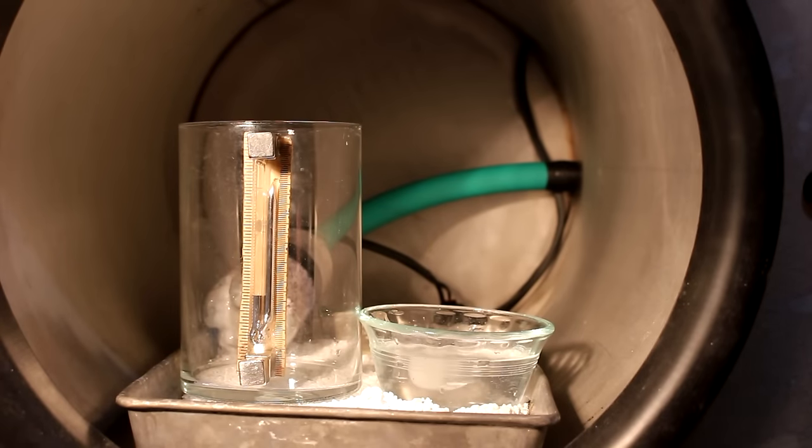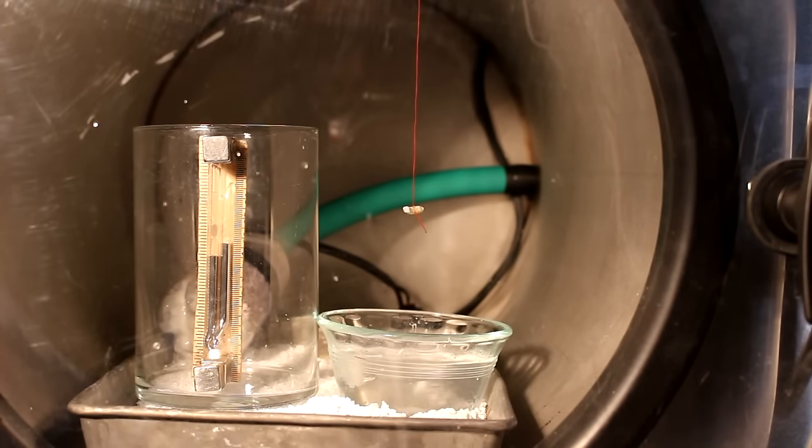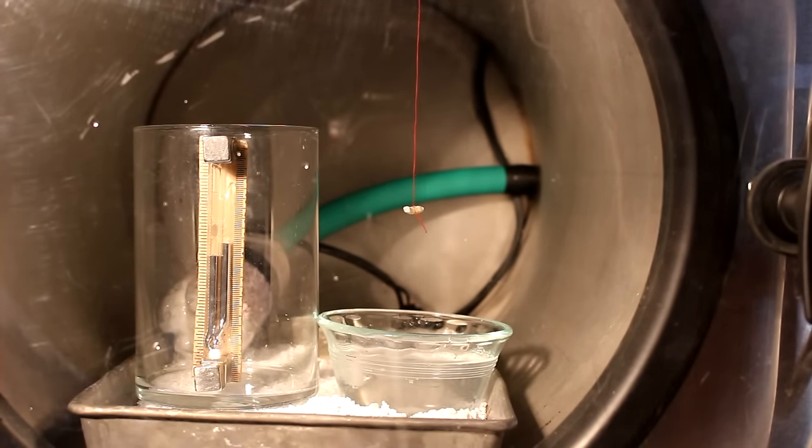Let's set something up and see what happens when you add the potassium to the water. Despite the ice cube, the water is beginning to boil, so I'm going to go ahead and turn off the pump. There we are.